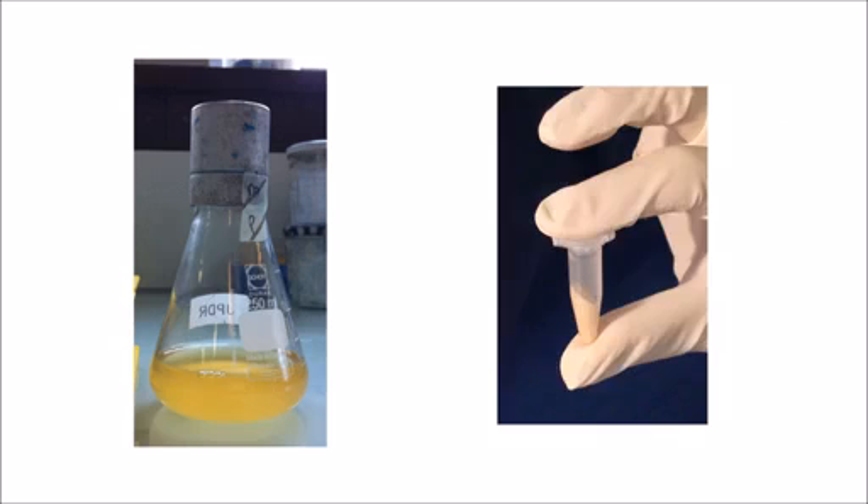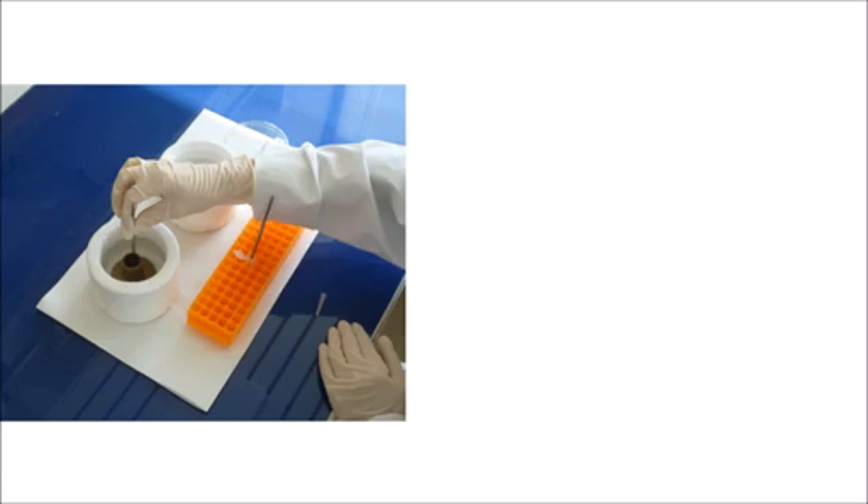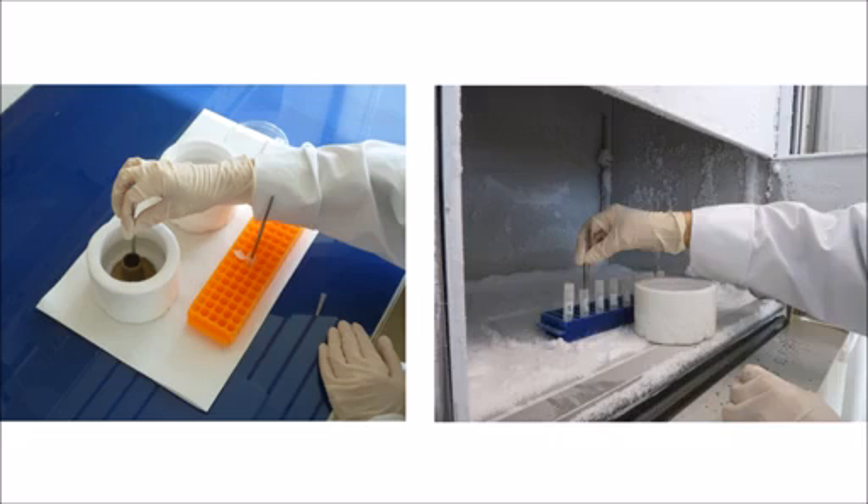This is a culture of suspension cells. First, the cells are harvested by different centrifugations to obtain a pellet in a microcentrifuge tube. In a second step, the sample is rapidly frozen by plunge freezing, which immobilizes the cells and limits the formation of ice crystals. Next, freeze substitution is performed in order to replace water by solvent containing osmium tetroxide fixative to stabilize cell structures.